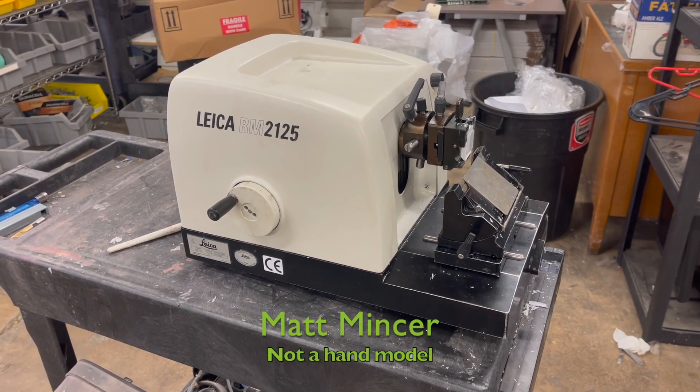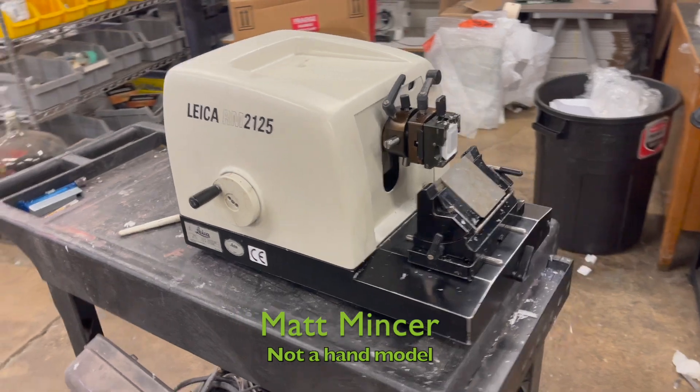Hey guys, it's Matt from TechOne. I wanted to do a quick video on this Microtome that just came into our shop.